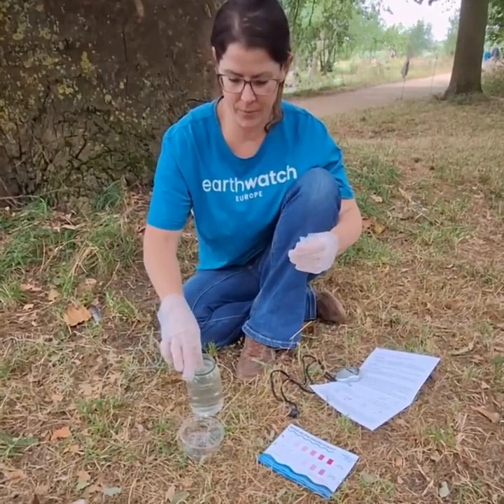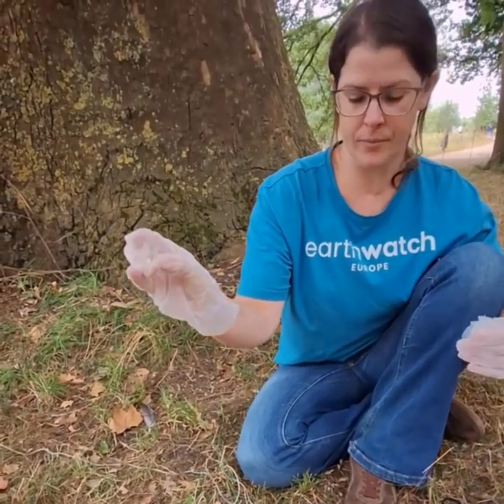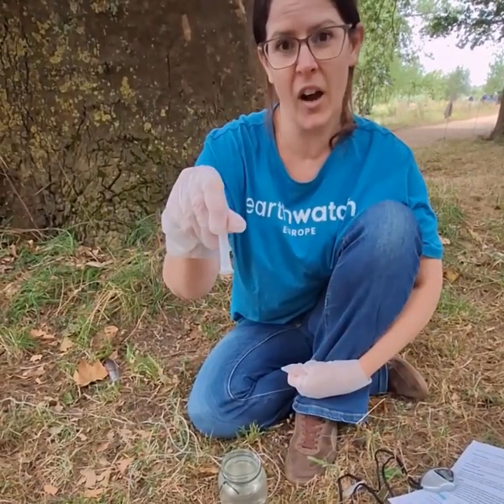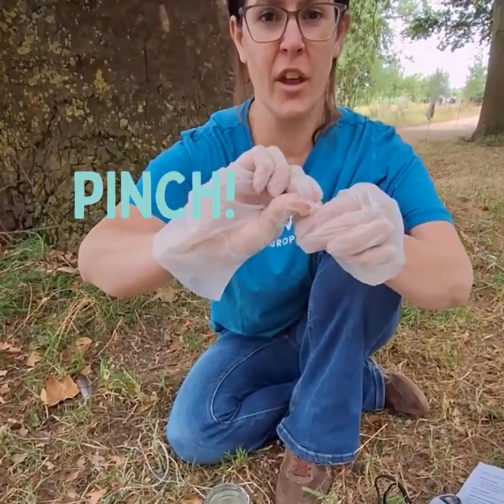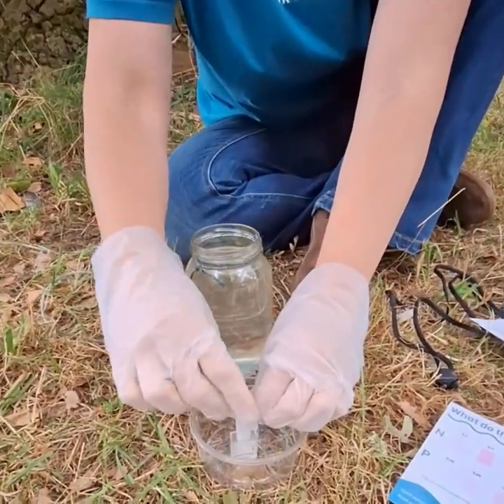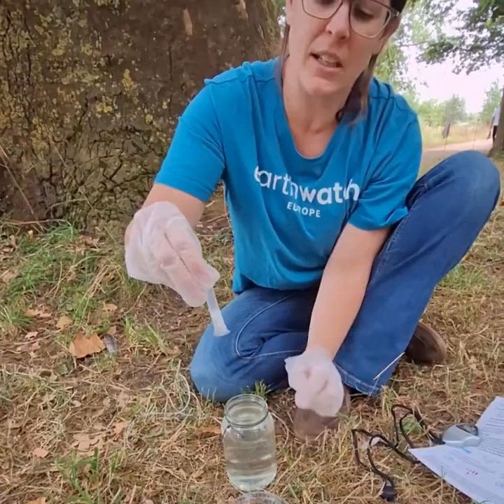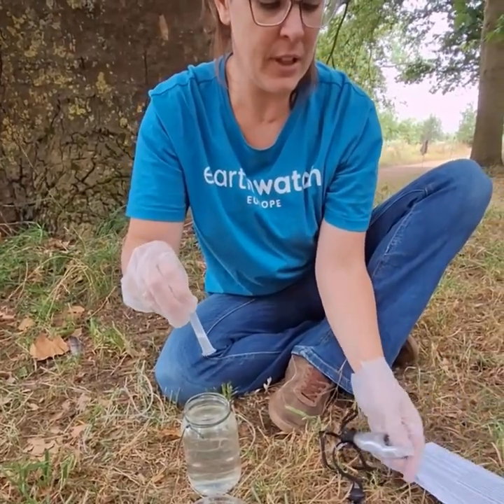Take my measuring cup, collect the water sample up to the line, and put that on a solid surface. I'm going to take my phosphate tube — this will take five minutes to react. Take the tube, pinch so that as much air is expelled from the tube as possible. Turn it upside down, place it in the cup, and release until all the water is sucked into the tube. Pinch the top and shake until all the powder has gone. Now you need to hit your stopwatch.